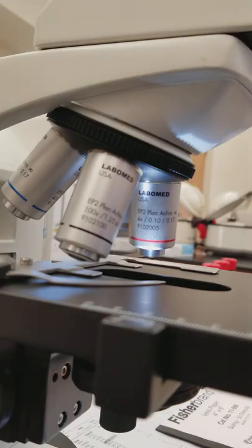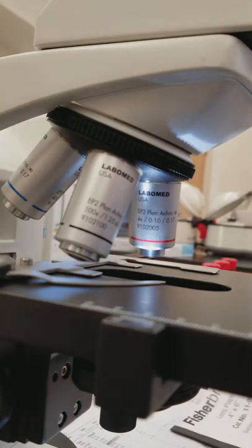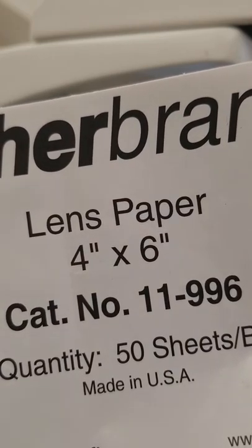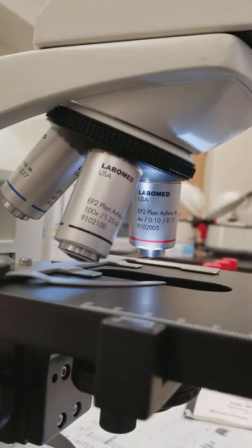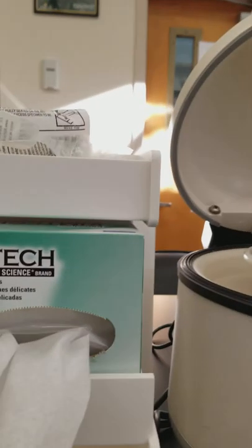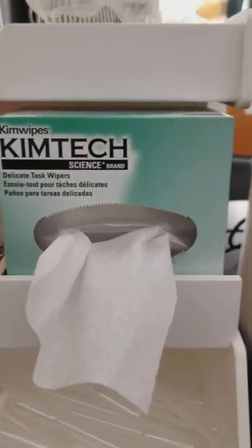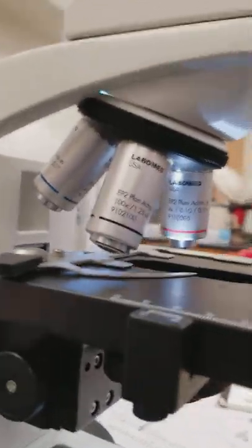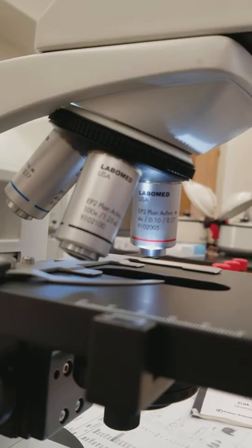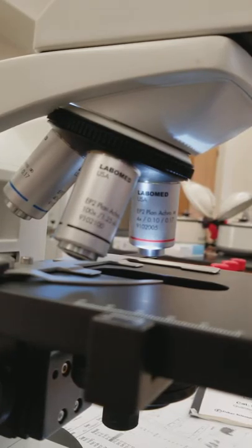When we go to clean it, we're going to get lens paper. Not a Kim wipe - you do not use that. That's going to end up scratching your lenses, and these are very easily scratched and expensive to replace.